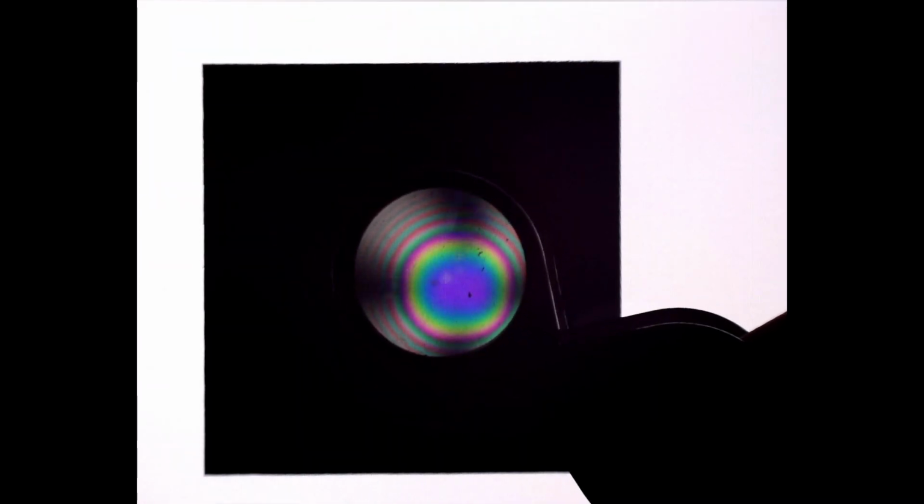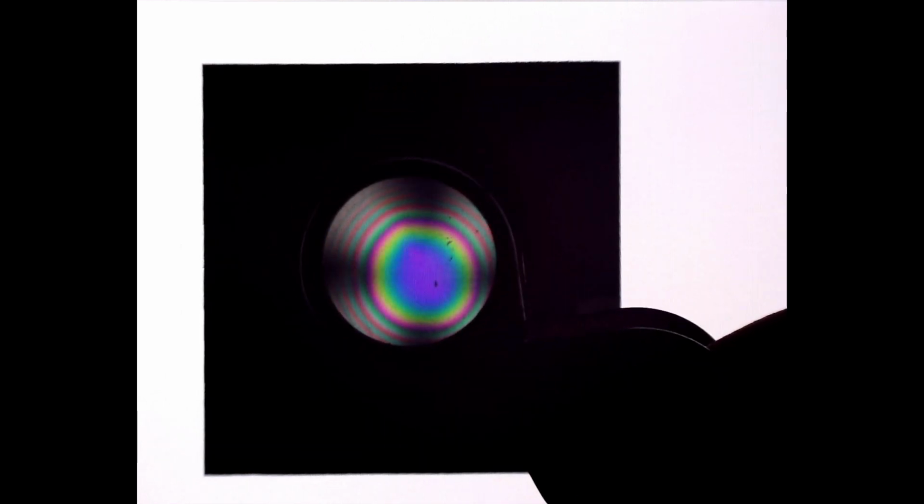Moving our converging lens over different areas of our quartz slice shows that there are some regions where the quartz uniaxial optic axis interference figure actually begins to distort. These are regions in our crystal where Brazil law twinning is going on, and if you actually had an appropriate Brazil law twin, you could generate what's known as Airy's spiral. And that is a whole different can of worms for a different day.